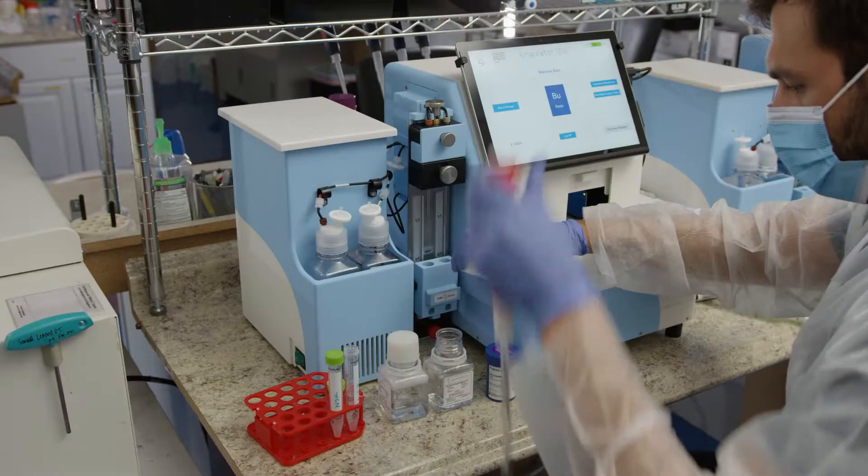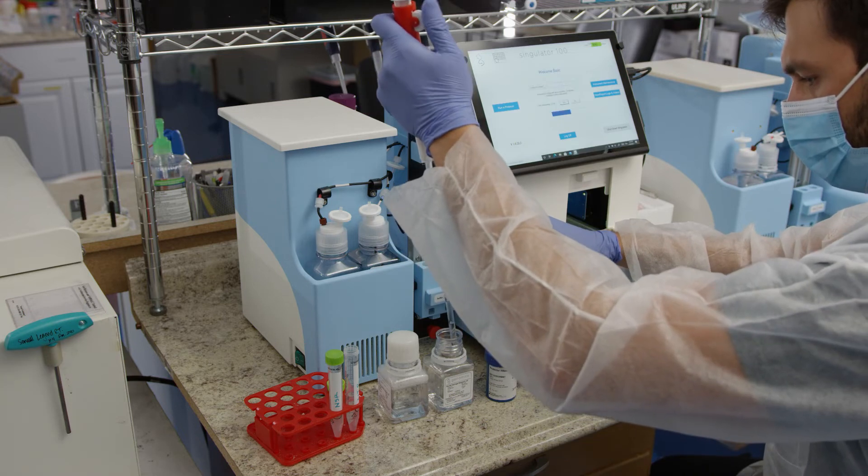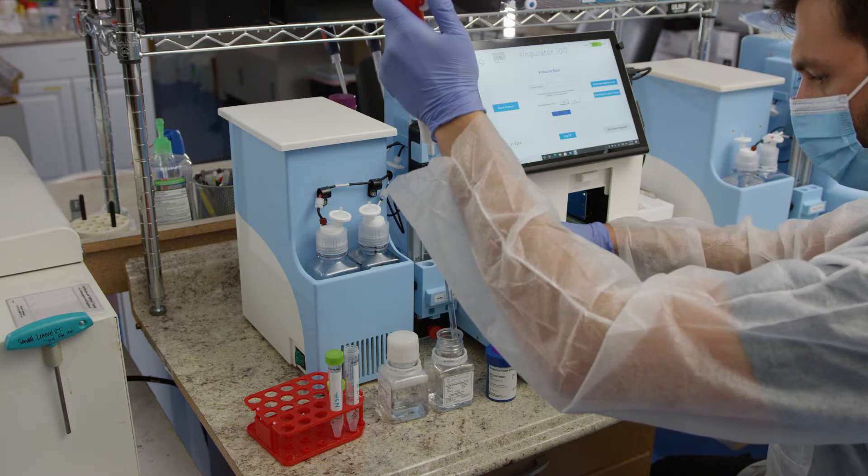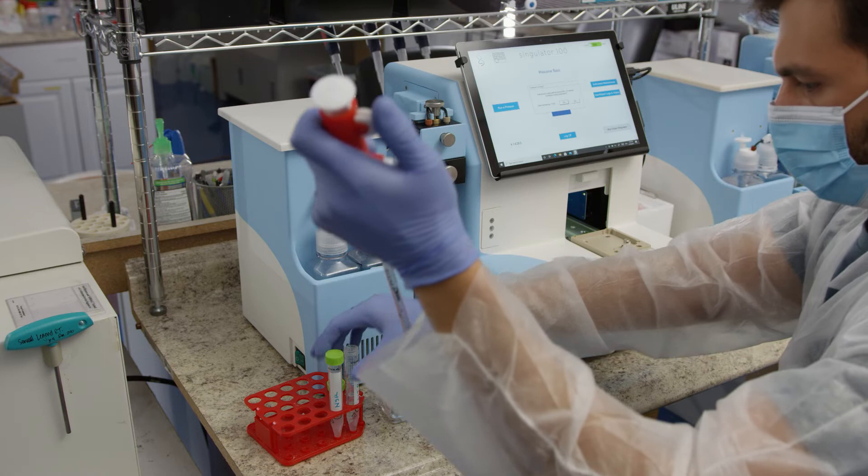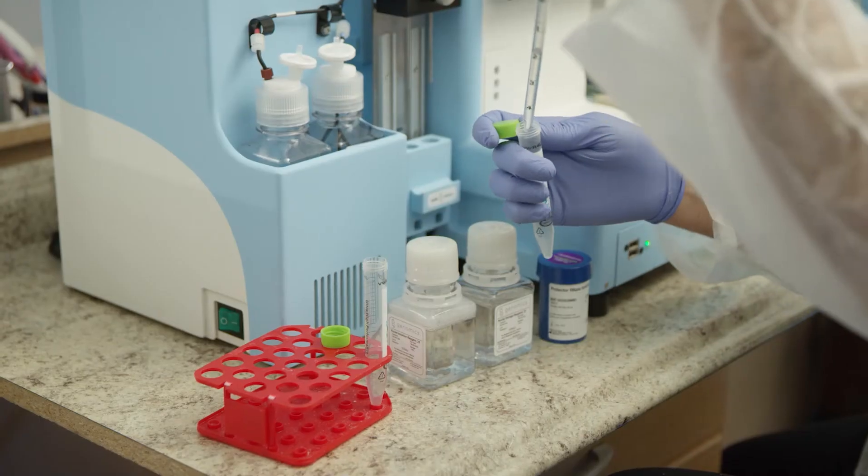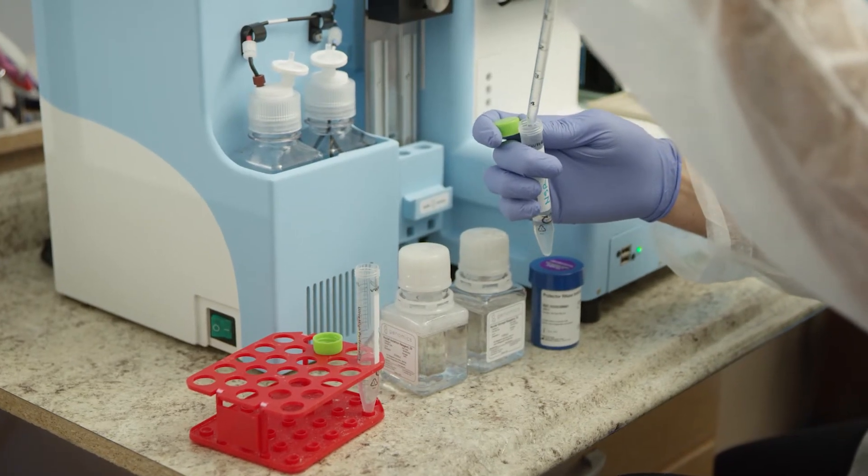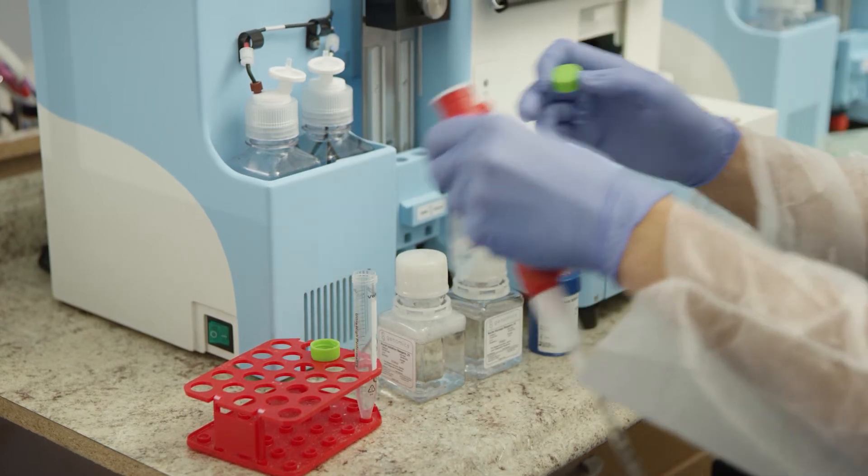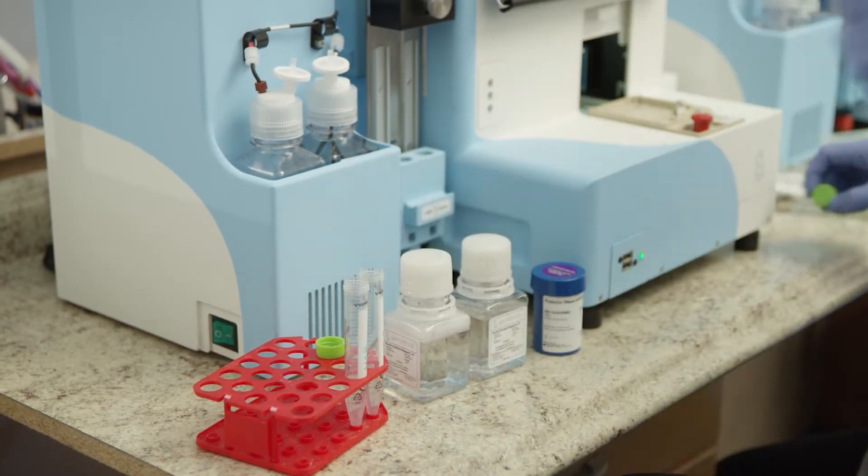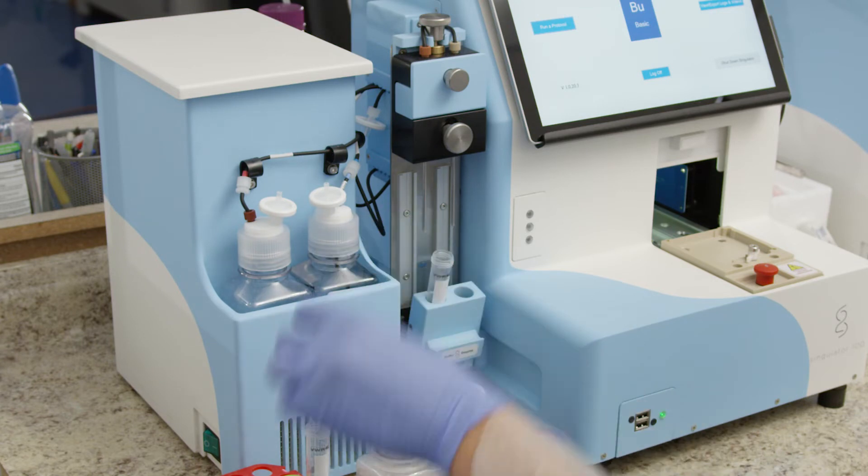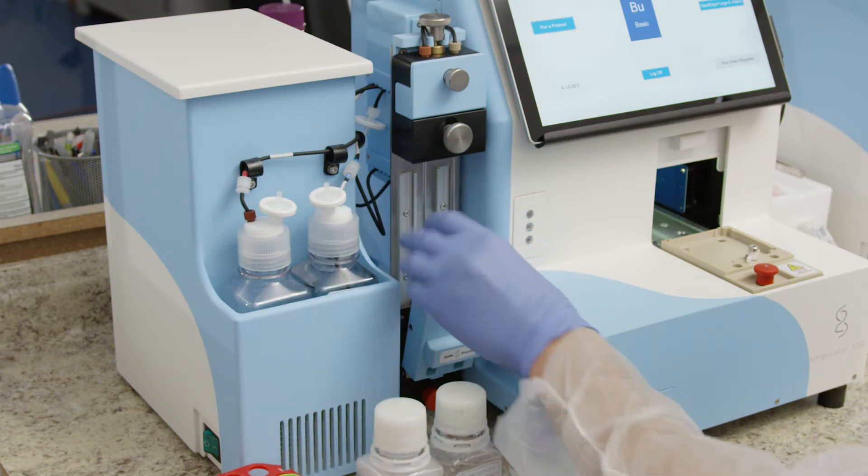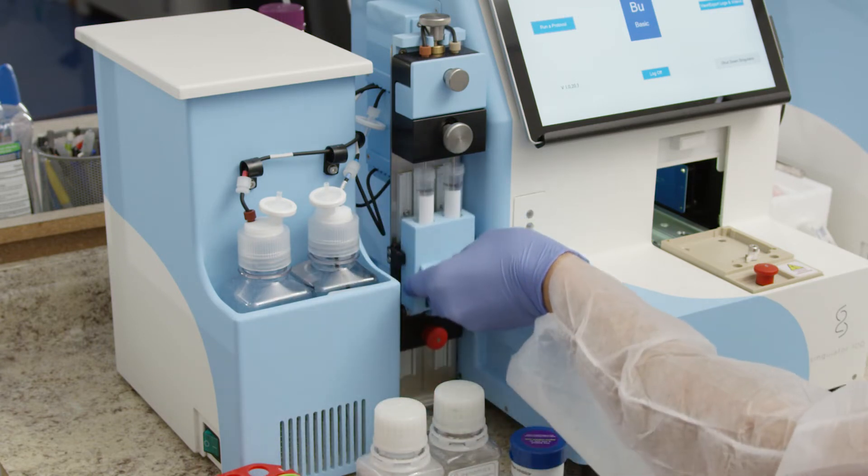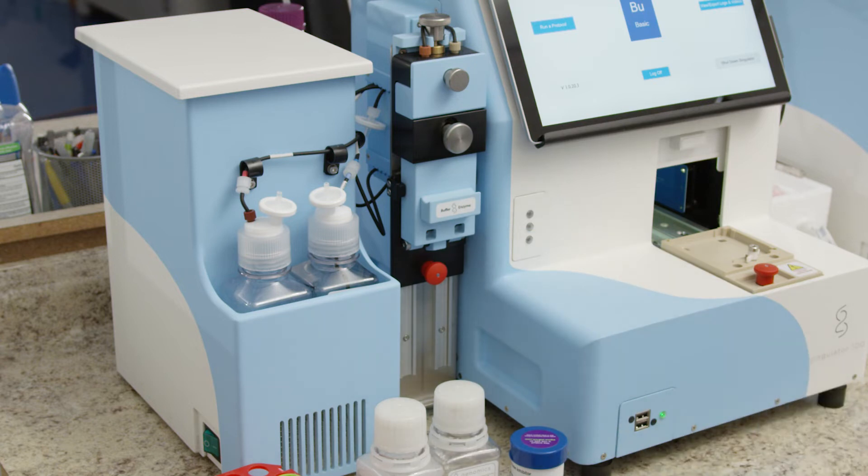Add 3 milliliters of NSR into a second conical tube. Place the NIR tube into the holder on the single shot mechanism labeled enzyme and the NSR tube in the holder labeled buffer. Close the blue handle so the tubes are vertical and slide the stage up by holding onto the blue handle until the red knob clicks into place.